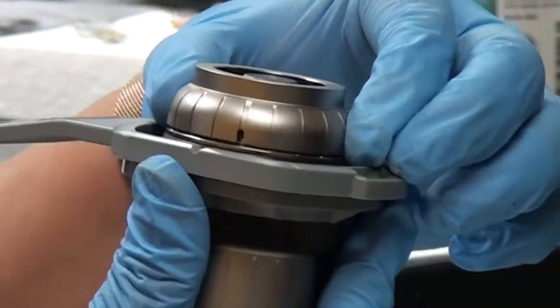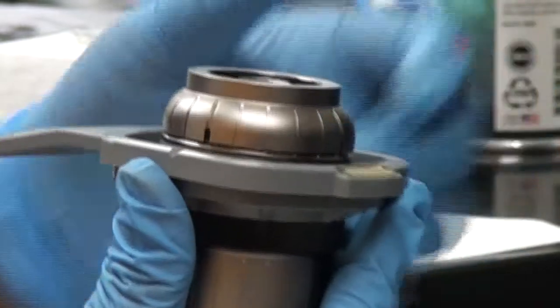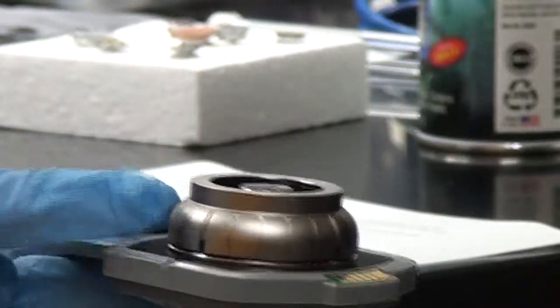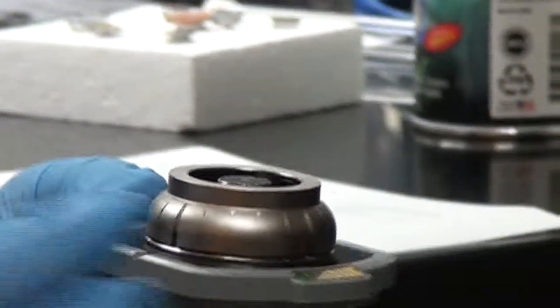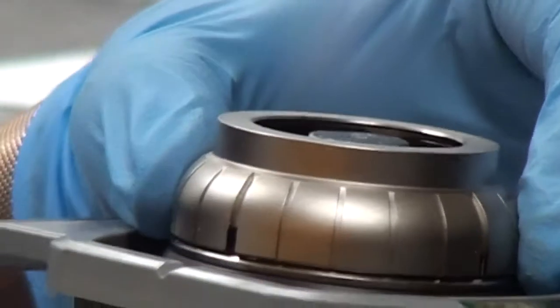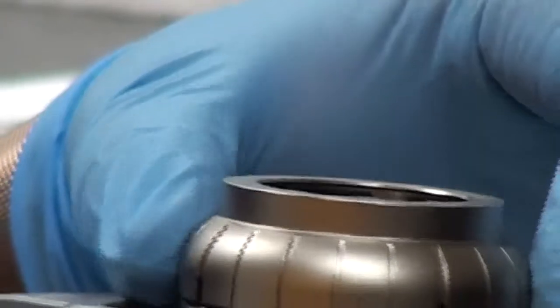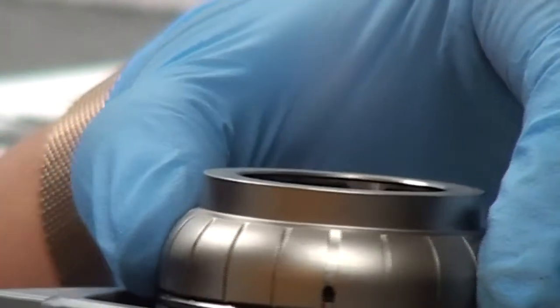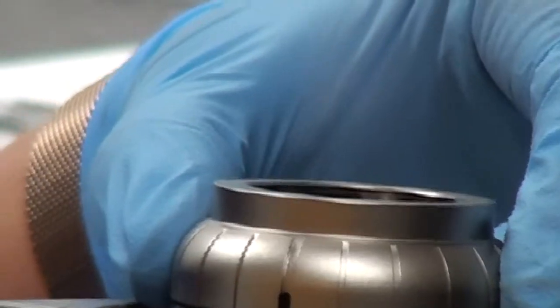Once the top of the sample is below the lip of the holder, the sample holder rim is rotated four more notches. You can see the notches on the rim here. We rotate four more notches to lower the sample to the optimal viewing distance. So now this is ready.